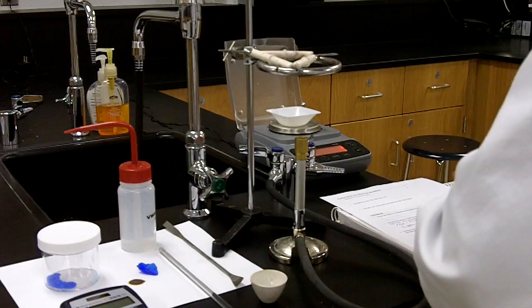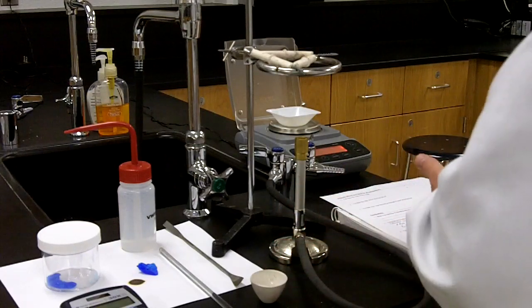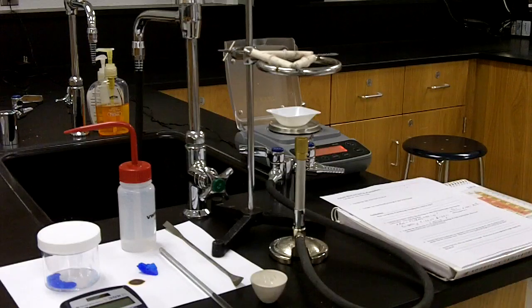So we'll look, we'll see what happens in just a moment. And we'll calculate, or determine, how much water left the hydrate experimentally, and compare that to what we get in our calculation.